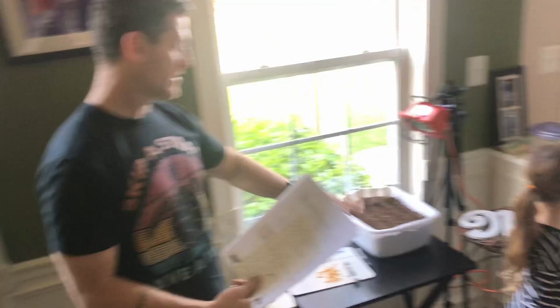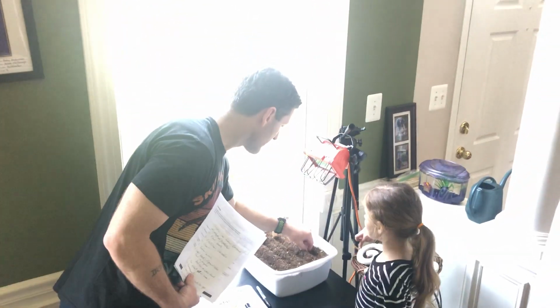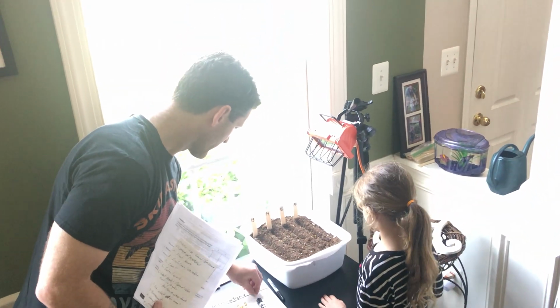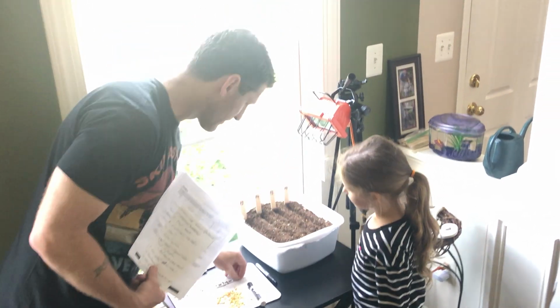Okay, it's time to go ahead and put the soil over top. Oh no. Hello, Wormy. We moved him. All right, I'll put this last one in. I can't pick it up. My hands are too... Ooh, that one's funny. It's got a hole in it. Let's not use that one.